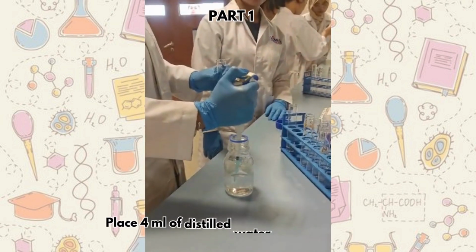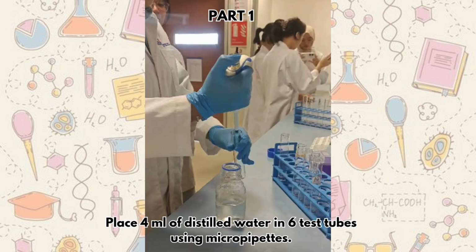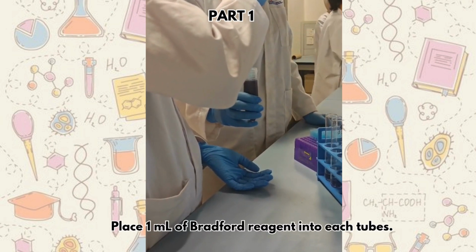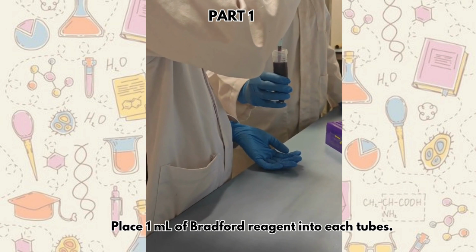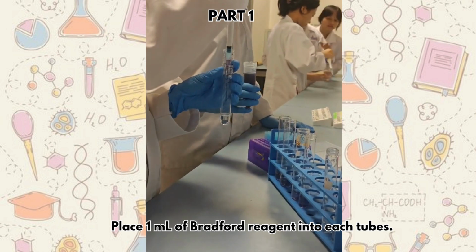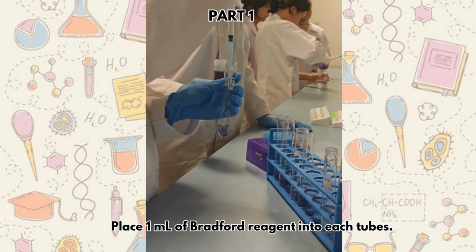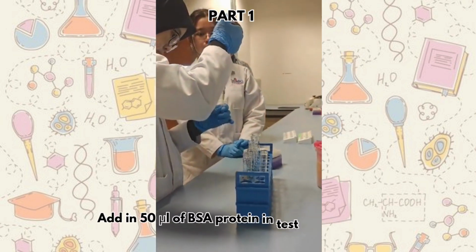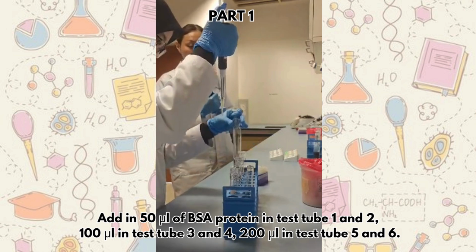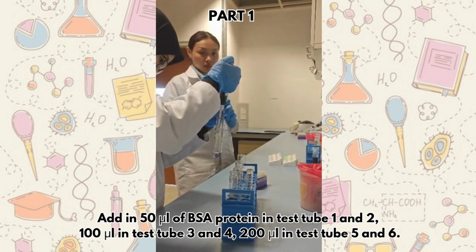Part 1. Place 4 ml of distilled water in 6 test tubes using a micropipette. Place 1 ml of Bradford reagent into each tube. Add 50 microliters of BSA protein in test tubes 1 and 2, 100 microliters in test tubes 3 and 4, and 200 microliters in test tubes 5 and 6.